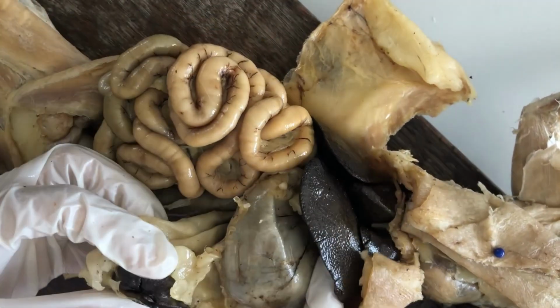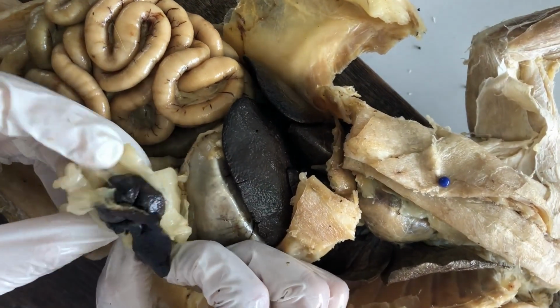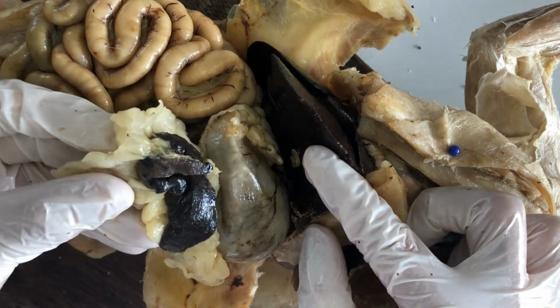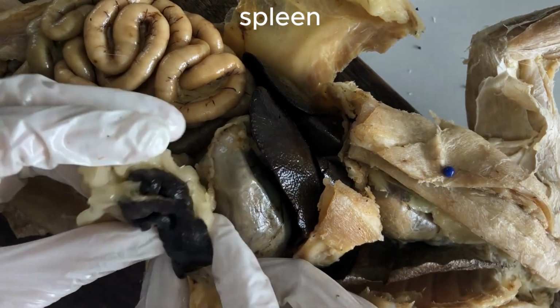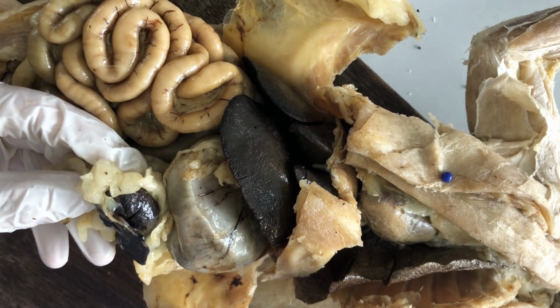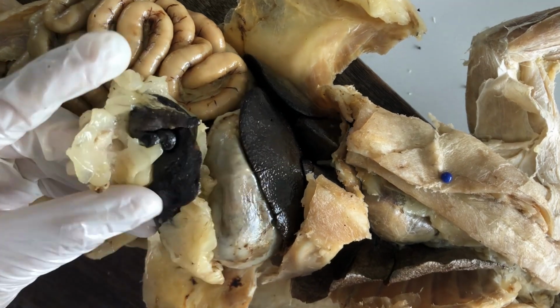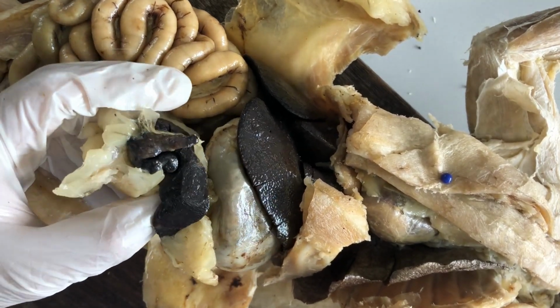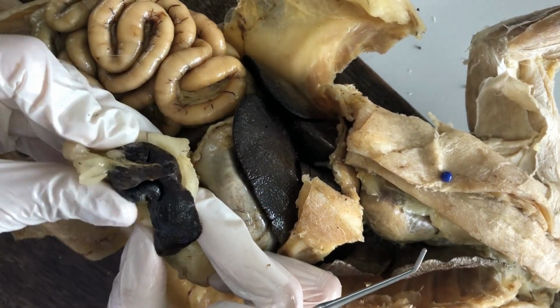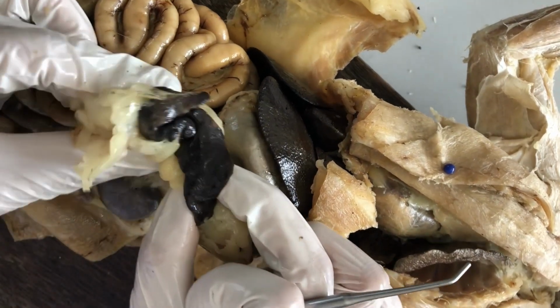There's this structure here just beside the stomach. It's always partnered with the stomach. Right? But it's not technically part of the digestive system, so I saved it for last. This dark organ here beside the stomach is called the spleen. So it's a lymphoid organ, another lymphoid organ, a source of blood cells. And one of its functions, aside from being a source of infection-fighting white blood cells, is for breakdown of old red blood cells. So the old red blood cells have to be recycled and broken down, and that's where the spleen comes in.